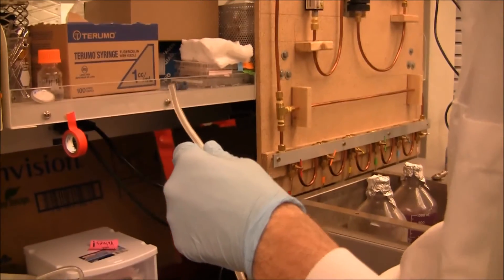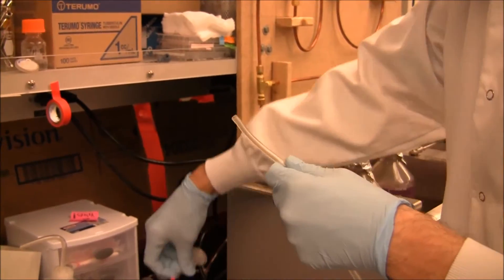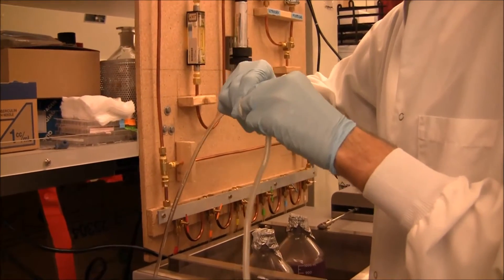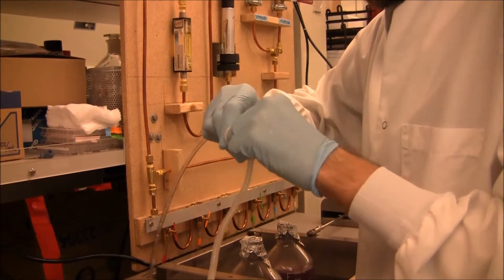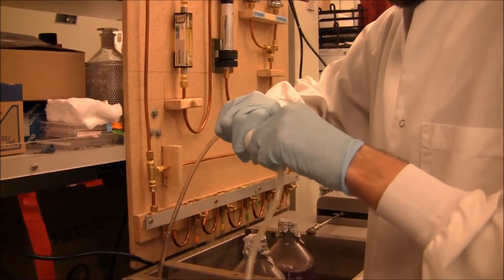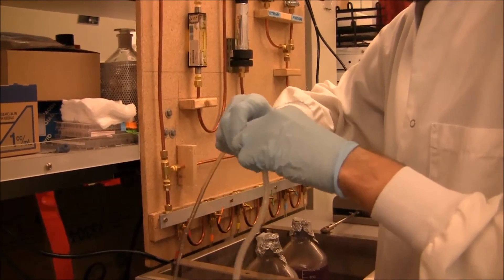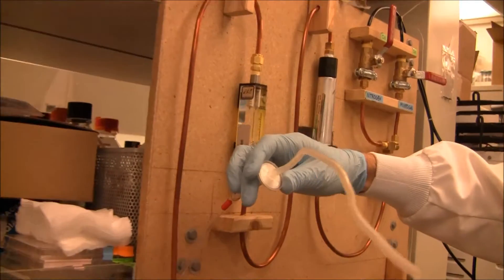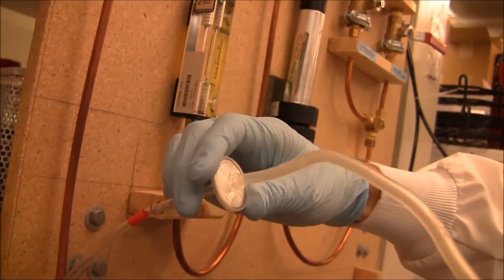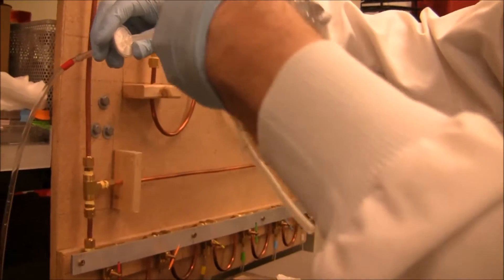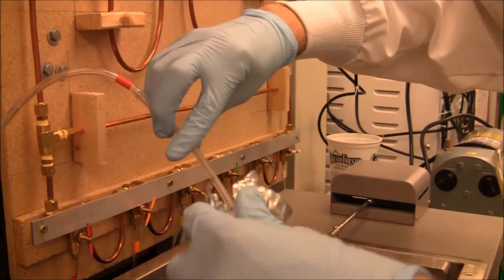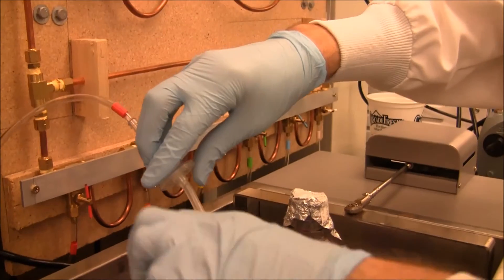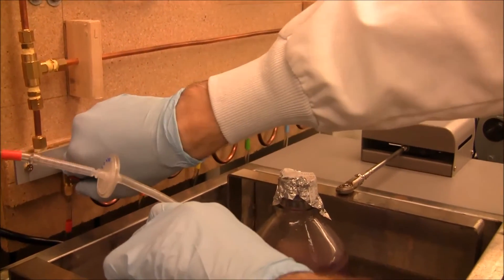So we take a tube, like this, place it on the end here. It's got a pretty snug fit. Then just stick it down in here, place the foil as best we can, and then turn it on.